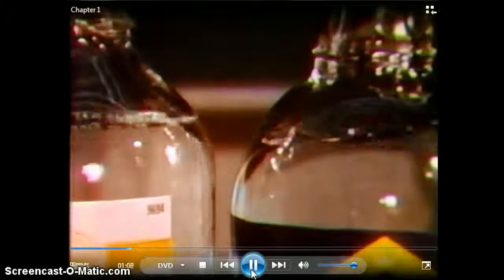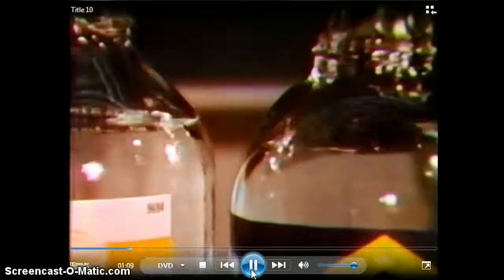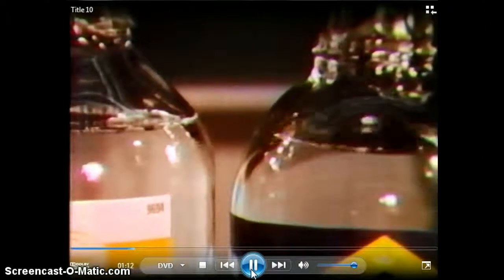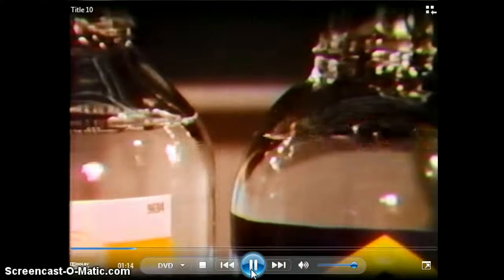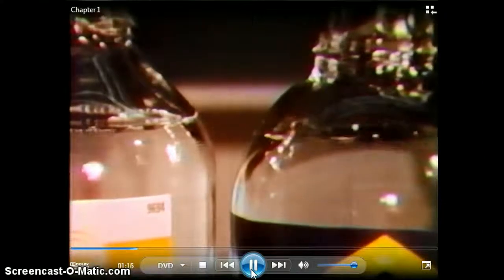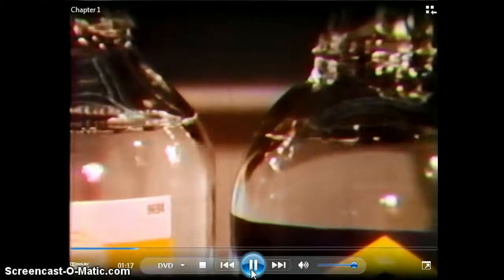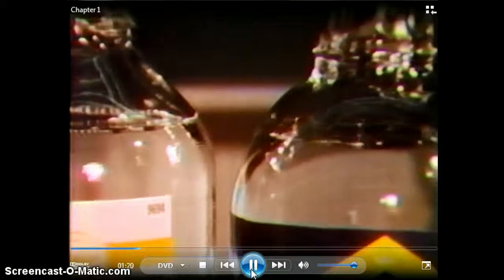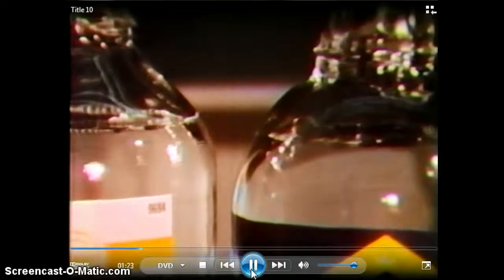Here we see that the sulfuric acid on the left returns to rest after agitation much more quickly than the hydrochloric acid on the right. This is due to its higher viscosity. The more viscous materials present some handling problems that the less viscous ones do not.